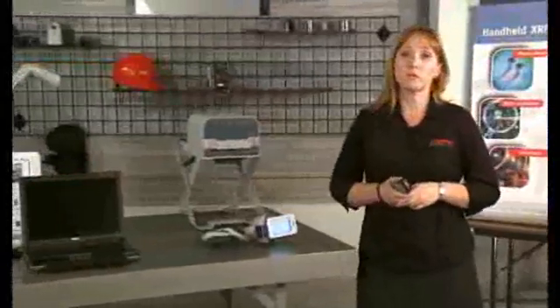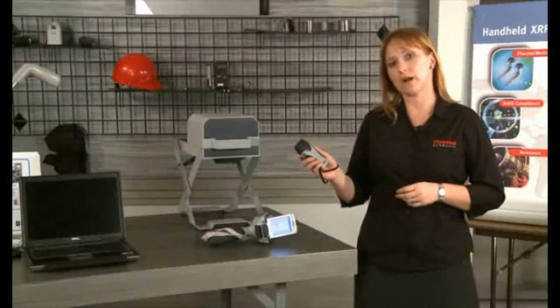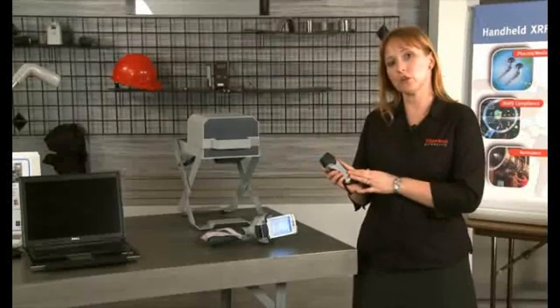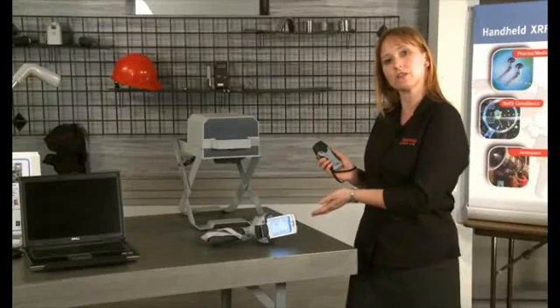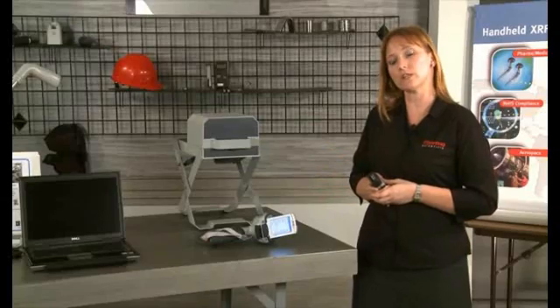You can also use Bluetooth barcode readers with your analyzer. There are two versions of wireless barcode readers, the scanner and the wand. Connect your barcode reader to your analyzer via Bluetooth, as described in your user's guide. Once the reader is connected, you can use it to input data into your analyzer.